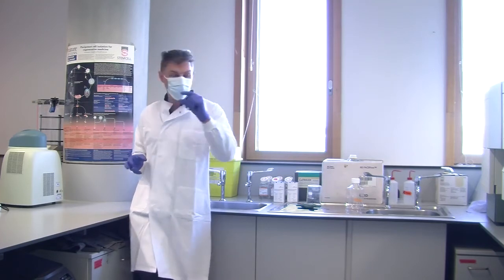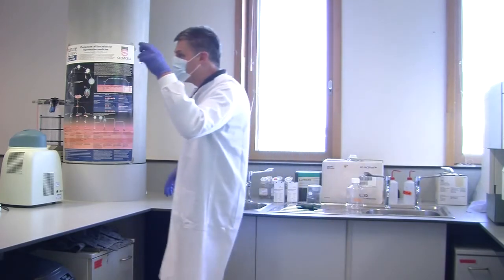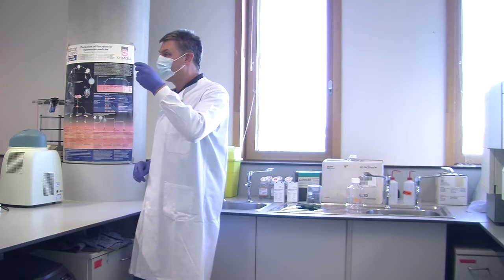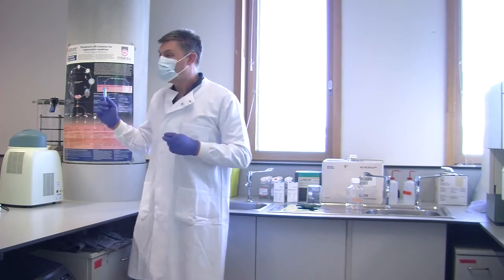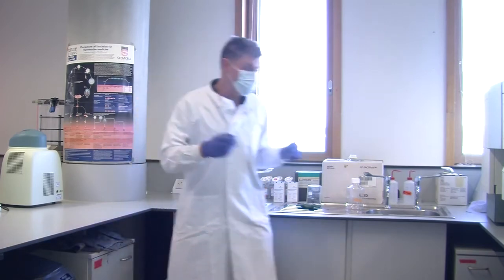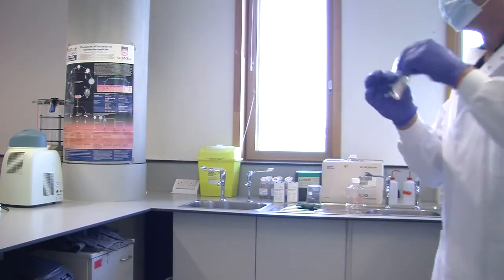If you leave a fluorochrome, so I've got fluorescent beads in here. They've only been in there for 20 minutes, it's not a problem. But if I left these out for a few days, they wouldn't be fluorescent anymore. And if I left them in really bright sunshine, by tomorrow they wouldn't be fluorescent anymore. So that's why all of the antibodies are in boxes. Very often, the beads in that tube come in this foil packet to block out the light.